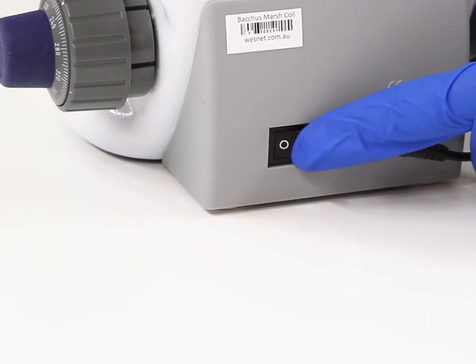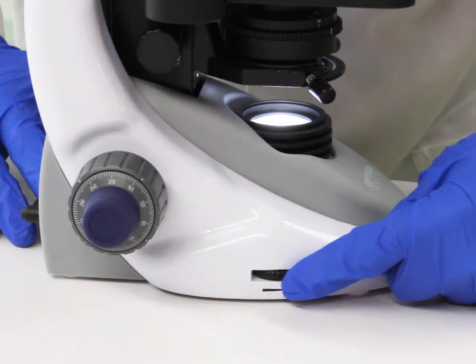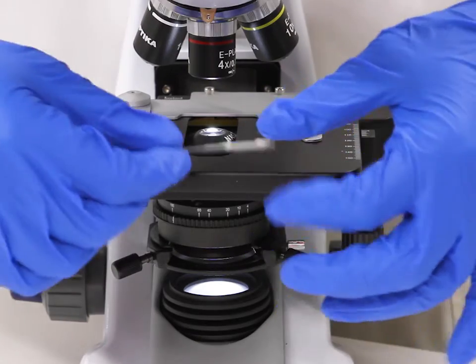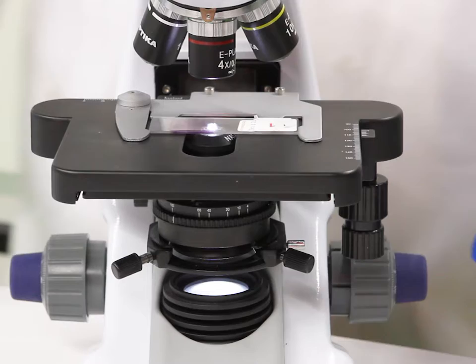To use the microscope, you start by turning on the light switch and adjust the brightness using a dimmer. Some other microscopes will use a mirror to reflect light up to your eyes. A prepared slide is placed on a stage between or under stage clips.